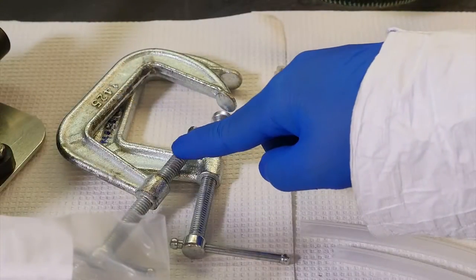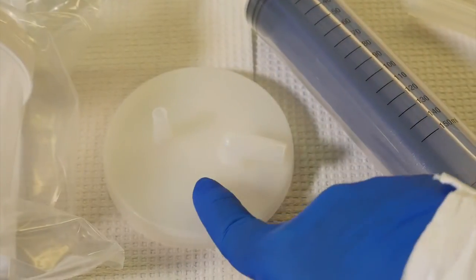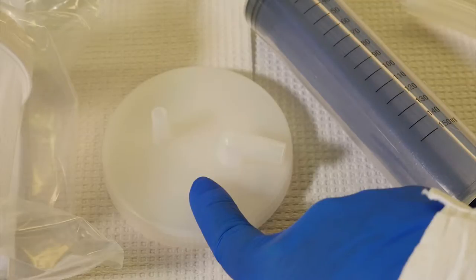Final components include two C-clamps to secure the bilge pump, a collection cup for eluent collection, and a collection cup lid with ports for connecting the collection cup to the filter.